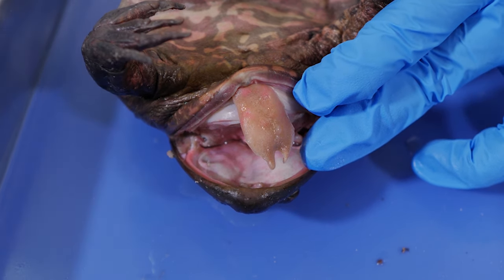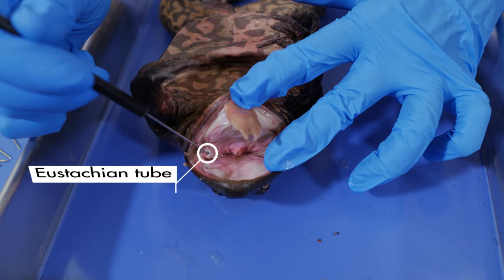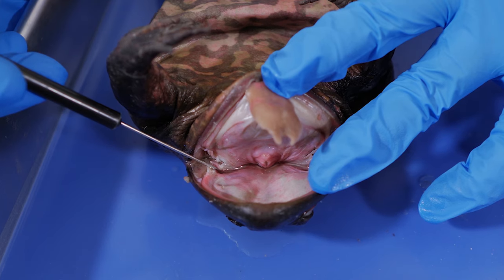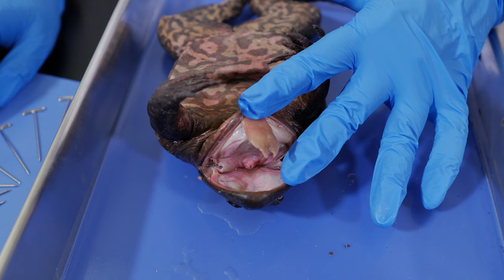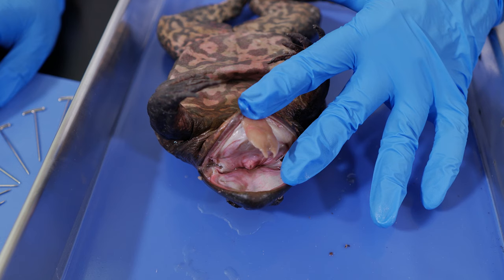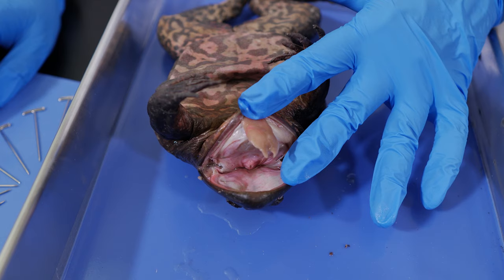If we pull the mouth open a little wider, we can see two openings at the side of the mouth near the back of the throat. These are the eustachian tubes, which equalize the pressure in the frog's ears while it is swimming. Between the two eustachian tubes is the beginning of the esophagus — the esophagus is a tube leading from the mouth to the stomach. Just below the esophagus is another opening, the glottis, which is the opening to the trachea, a tube that leads to the frog's lungs.